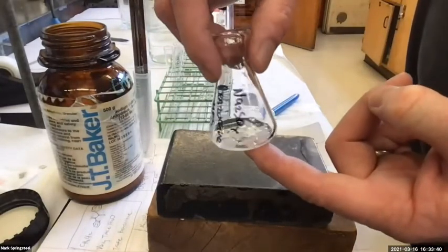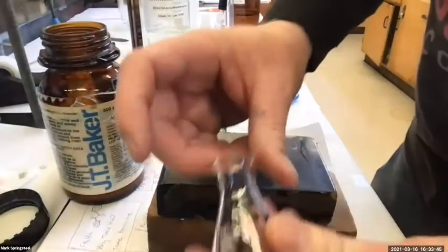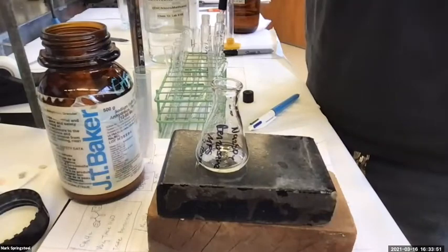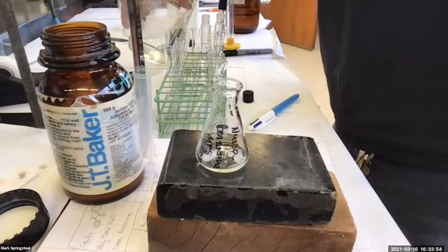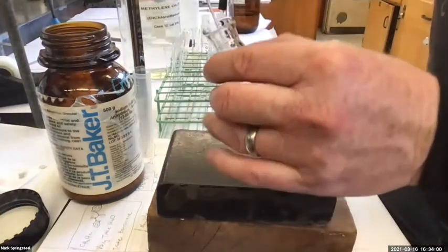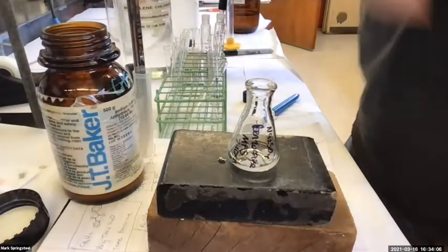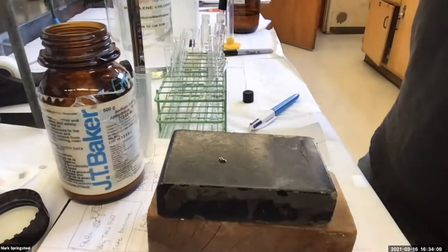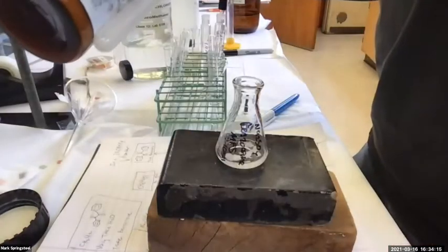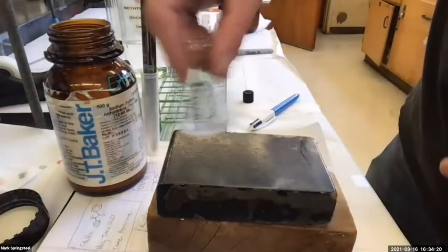Oh, I see a few little grains that are not clumps. I'm gonna do just a little. I do actually see up at the top of my flask little droplets of water stuck there, and I want to wash those down in so they'll get clumped too. So I'm gonna use a little bit of methylene chloride and just rinse that down and in. I think I need another one. Okay. And some more sodium sulfate. I'll go a little heavy-handed, get this done.